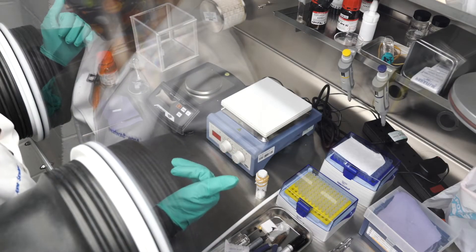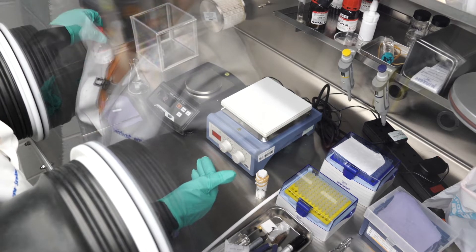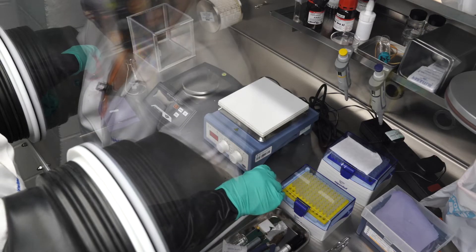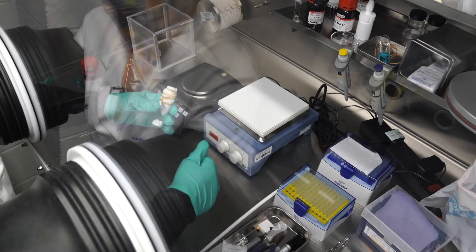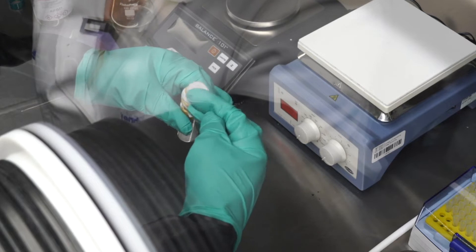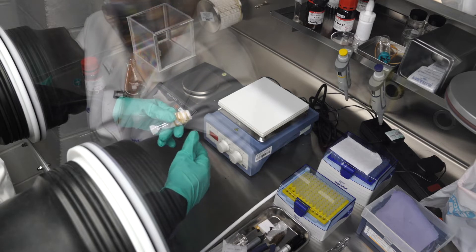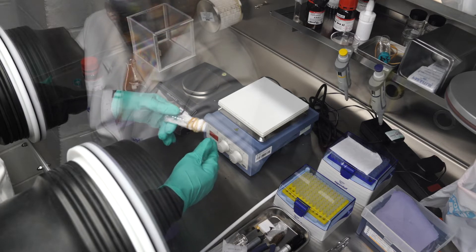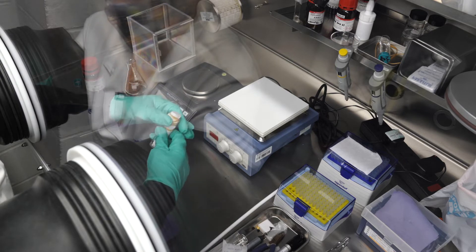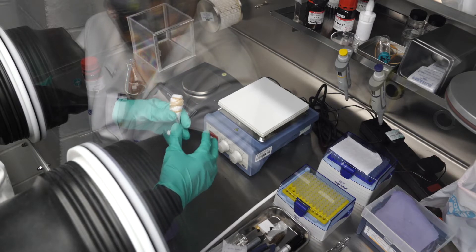Today I'm going to make sodium perchlorate based electrolyte for a sodium ion battery. Here's my sodium perchlorate. Yesterday I put some of that into a bottle covered with a porous wipe and secured so I could dry it with the vacuum antechamber on its side to increase the surface area. This provides a more dry, water-free salt to add to my electrolyte.